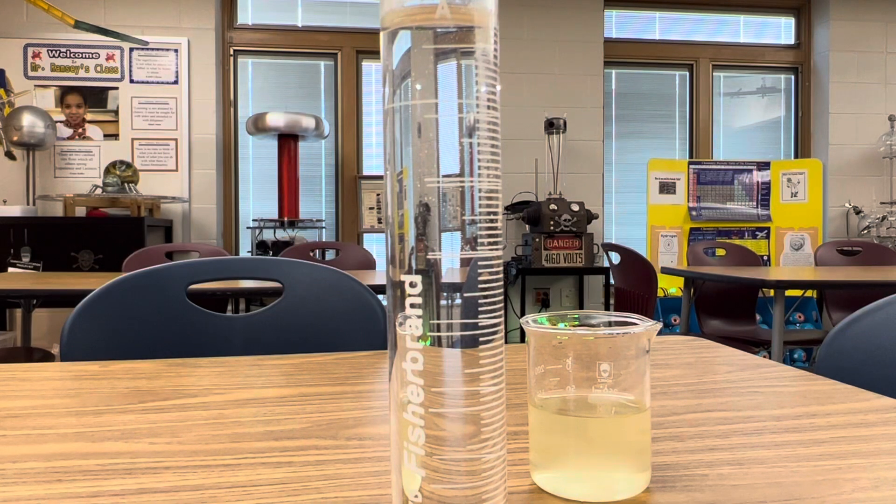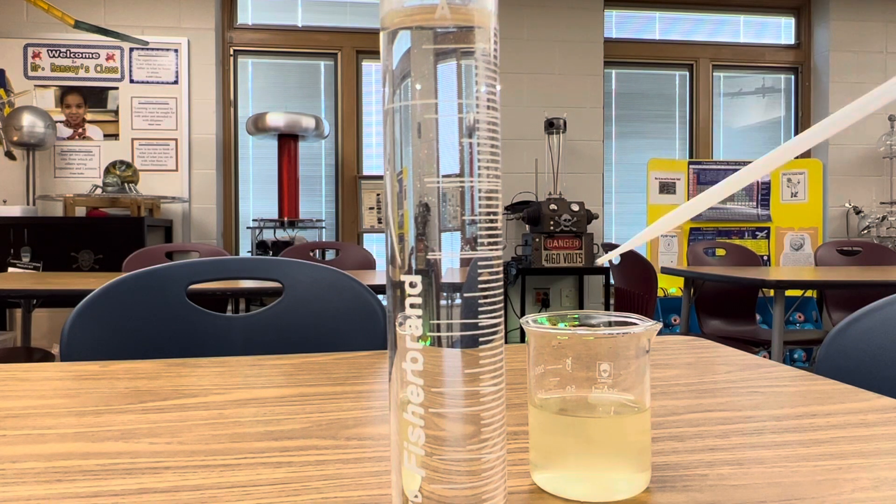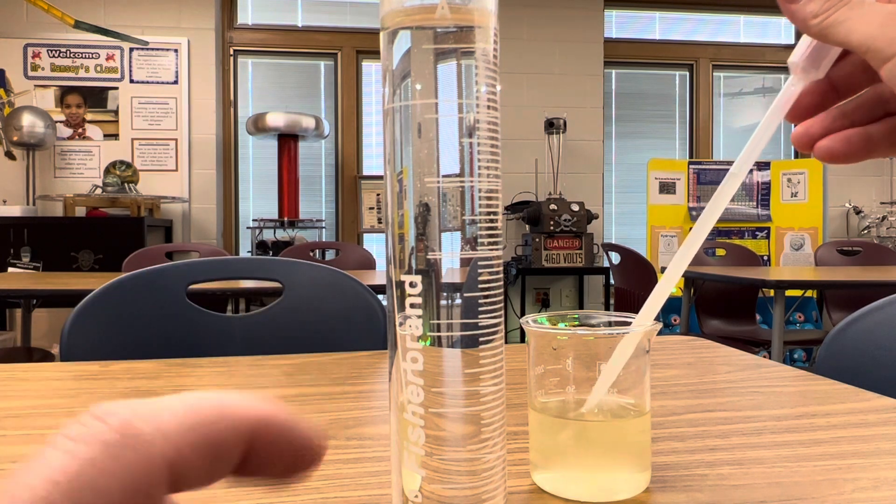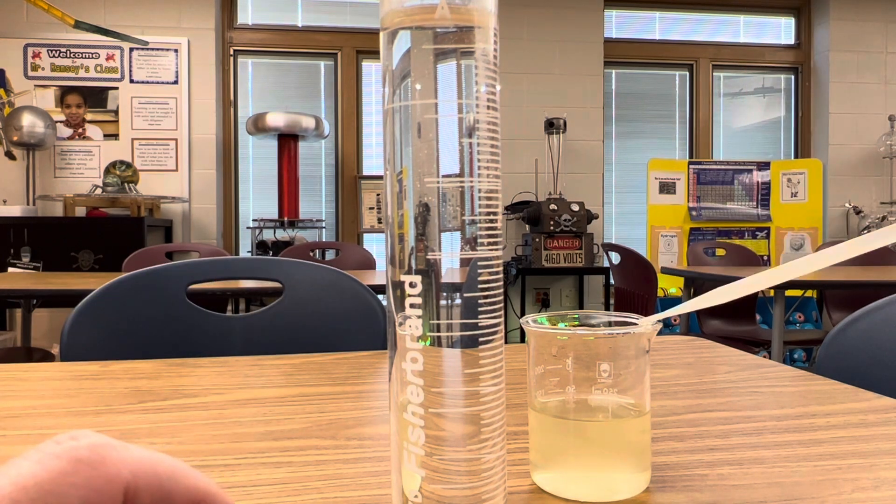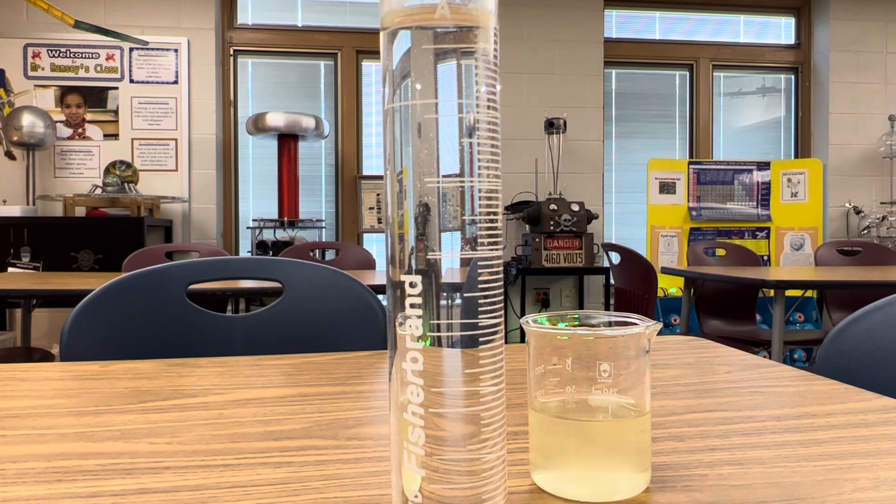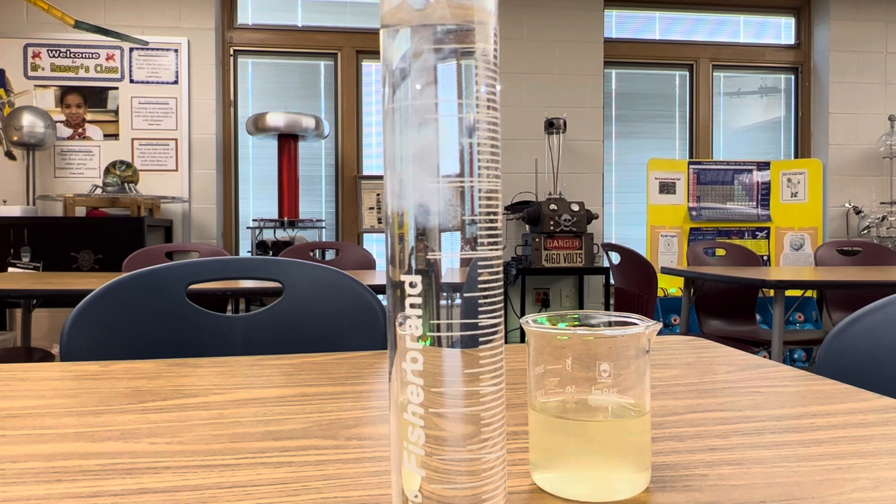And now it's time for the reaction. I'm going to add drops of my sodium sulfide to my solution of zinc nitrate. You can see the sodium sulfide is kind of a clear solution. It has a little bit of a yellow tint, but look at the amazing insoluble precipitation when I add it.